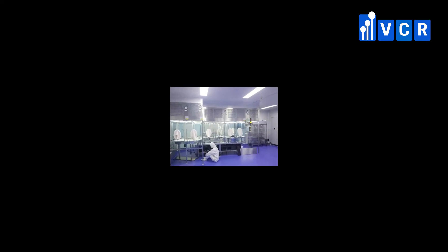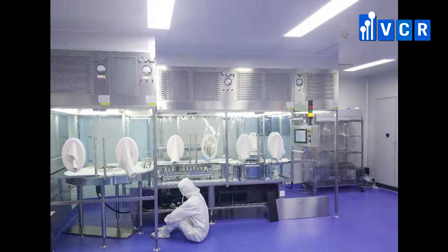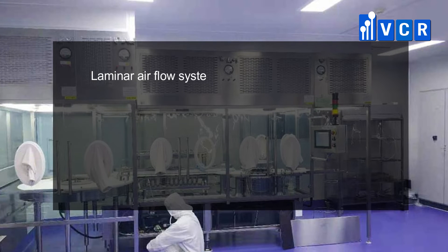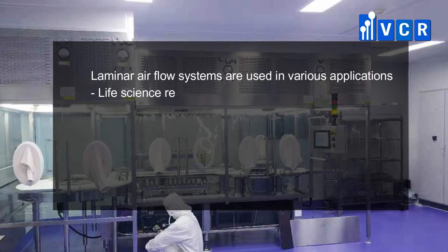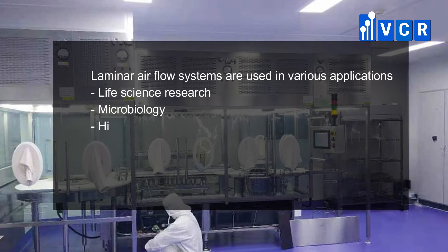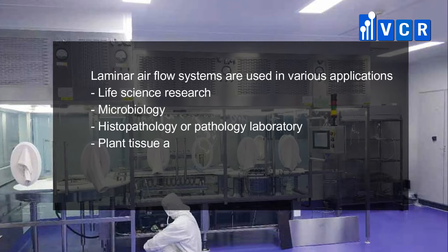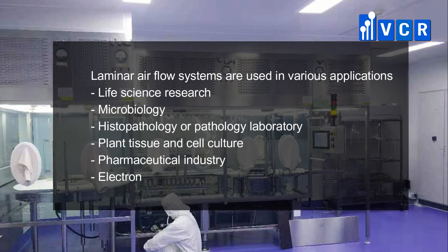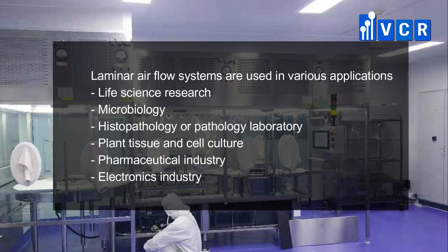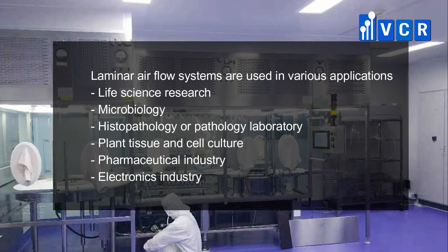Laminar Airflow is suitable for a variety of applications, especially where a clean air environment is required for smaller items, like electronic devices. Laminar Airflow can be tailor-made to the specific requirements of the clean rooms, especially in the medical, pharmaceutical, and electronic industries.